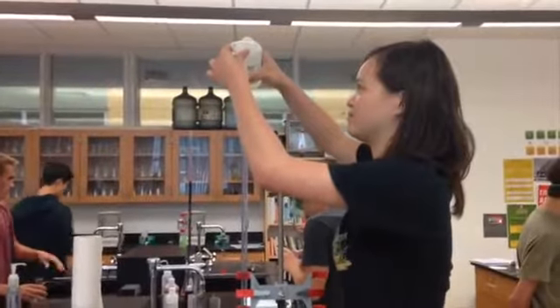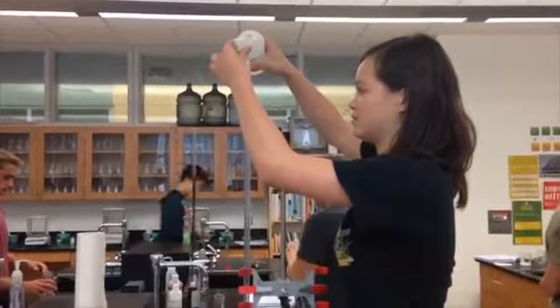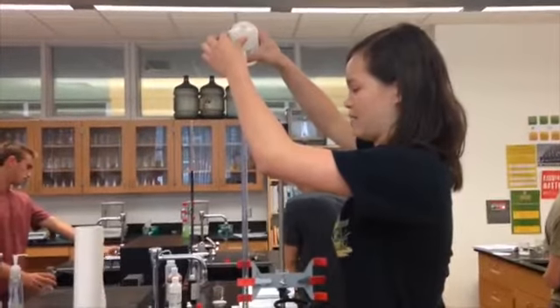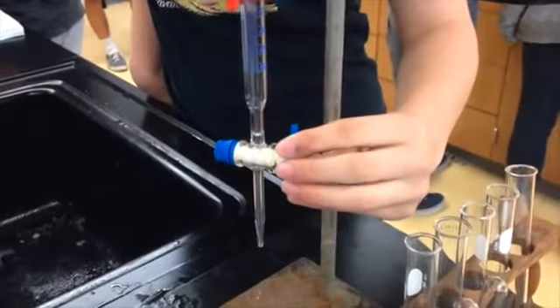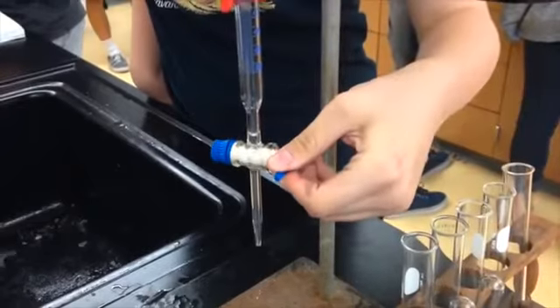Then get somebody tall to pour 50 ml of sodium hydroxide into the burette. Make sure the burette is in a closed position while pouring. Up and down is open, horizontal is closed.